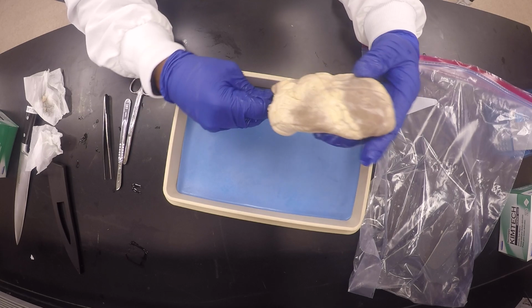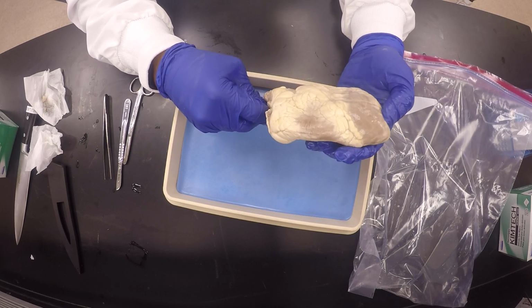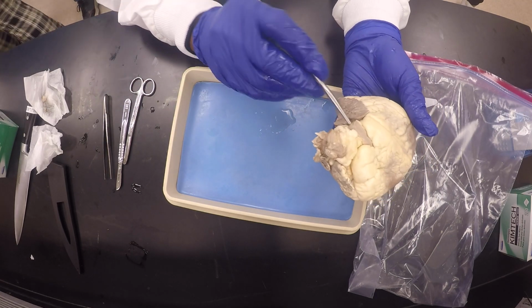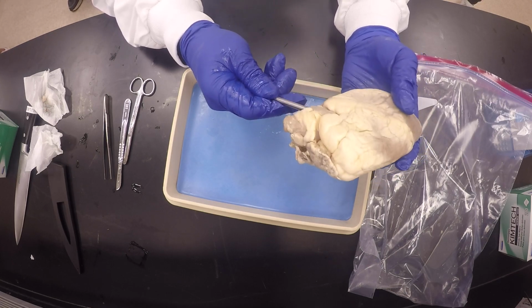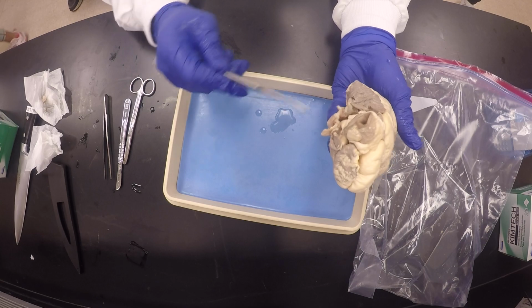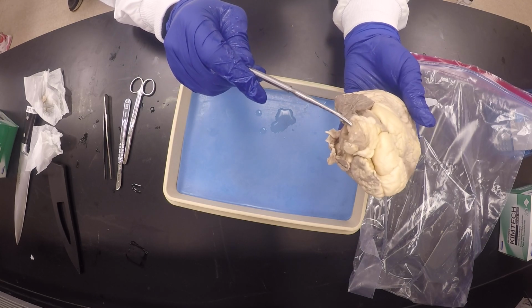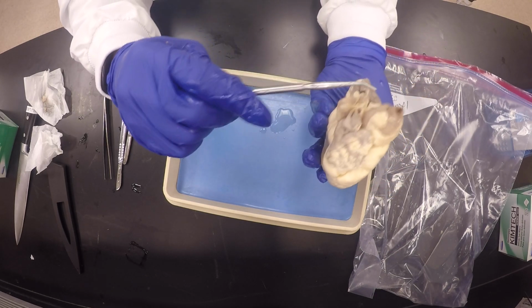And if you were to go through, it's going to this side. You see how it's on the left side? It's right here, I can feel it right here. When I went through here, I was going to the right side. That's the pulmonary trunk. This is a small branch, the brachiocephalic trunk. Sometimes you don't see it. Sometimes this is the aorta. You can see how it's already starting to curve that way.